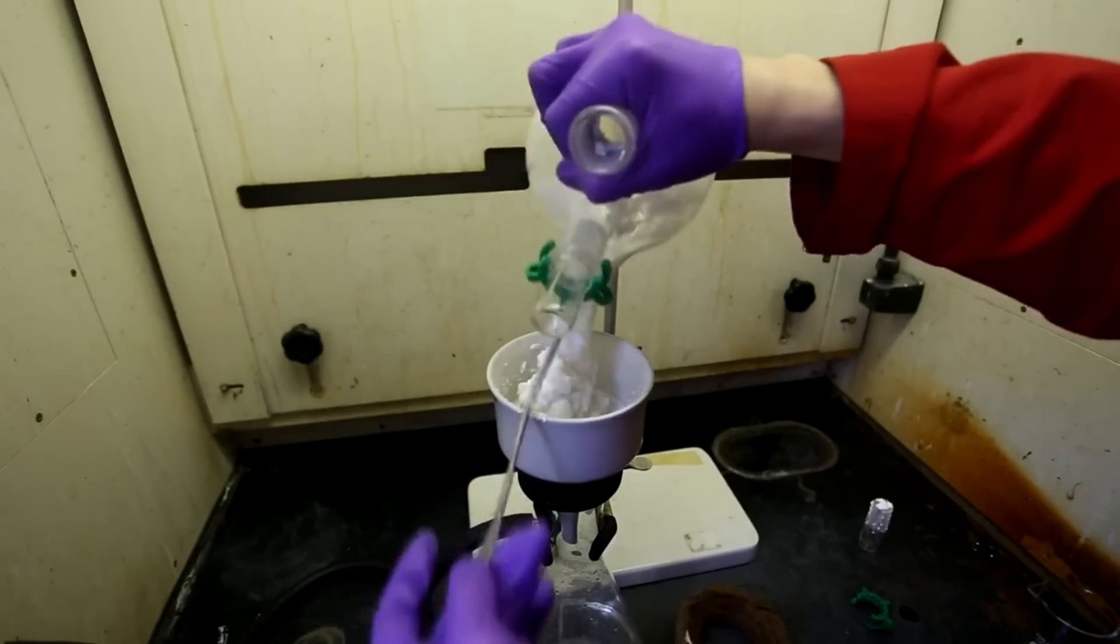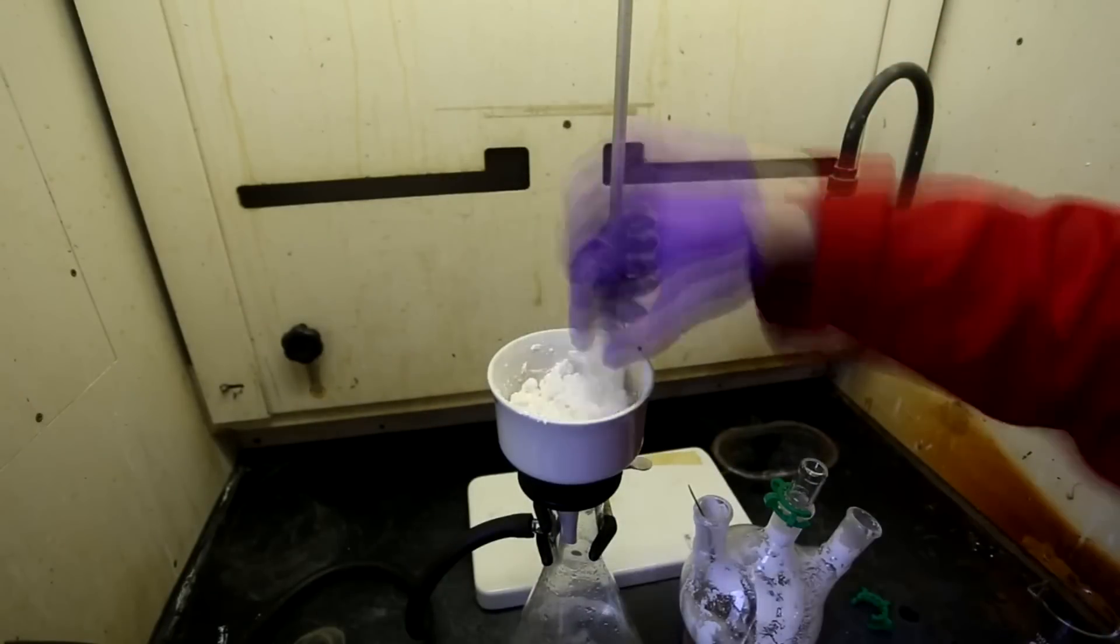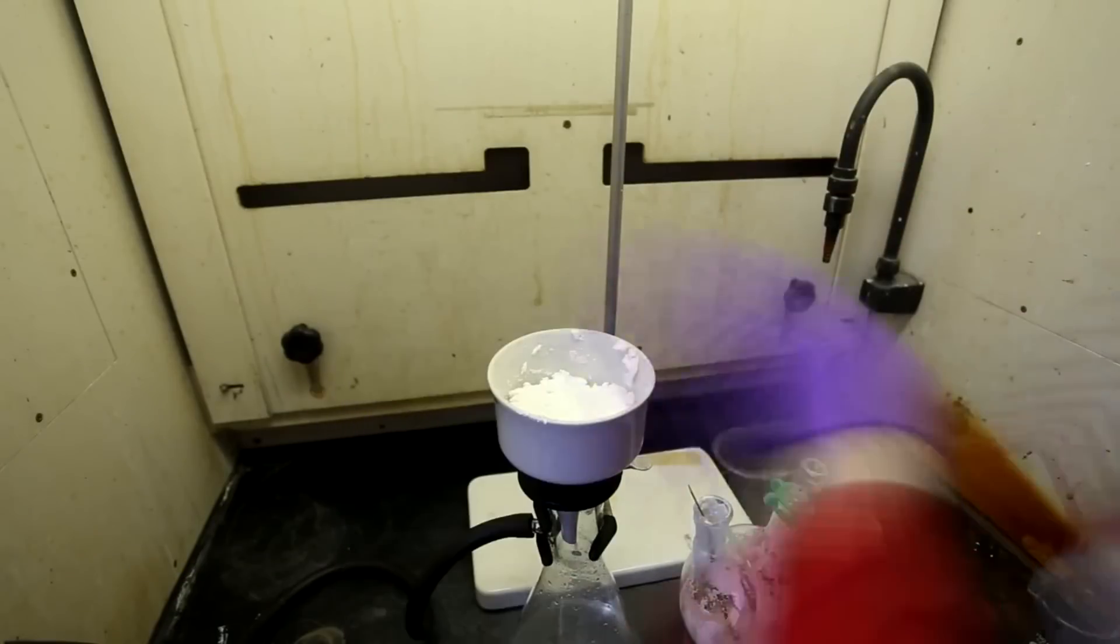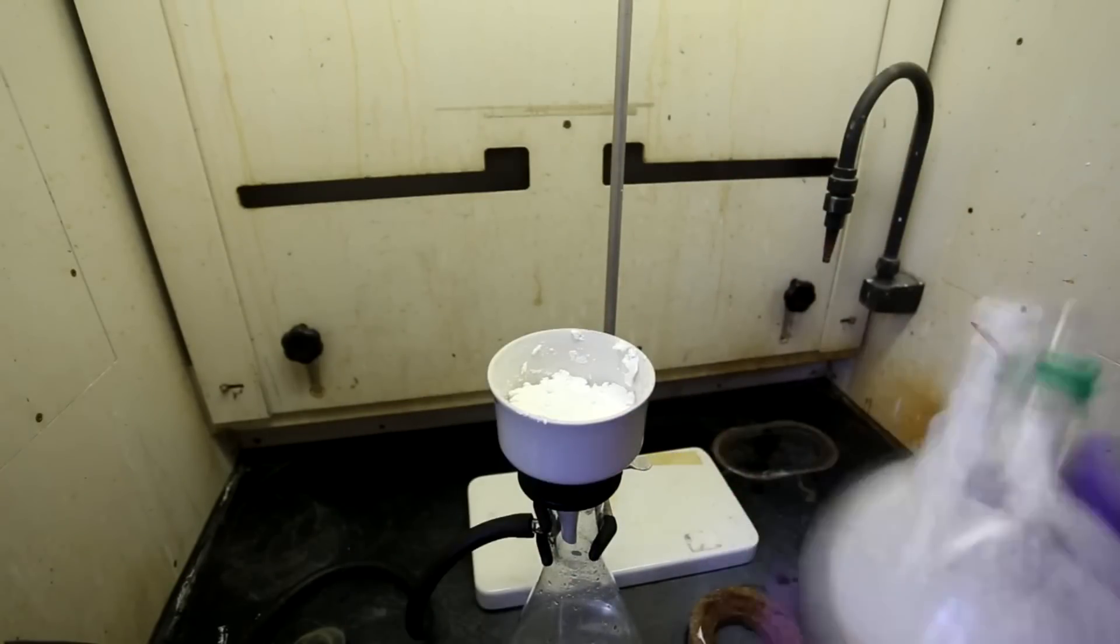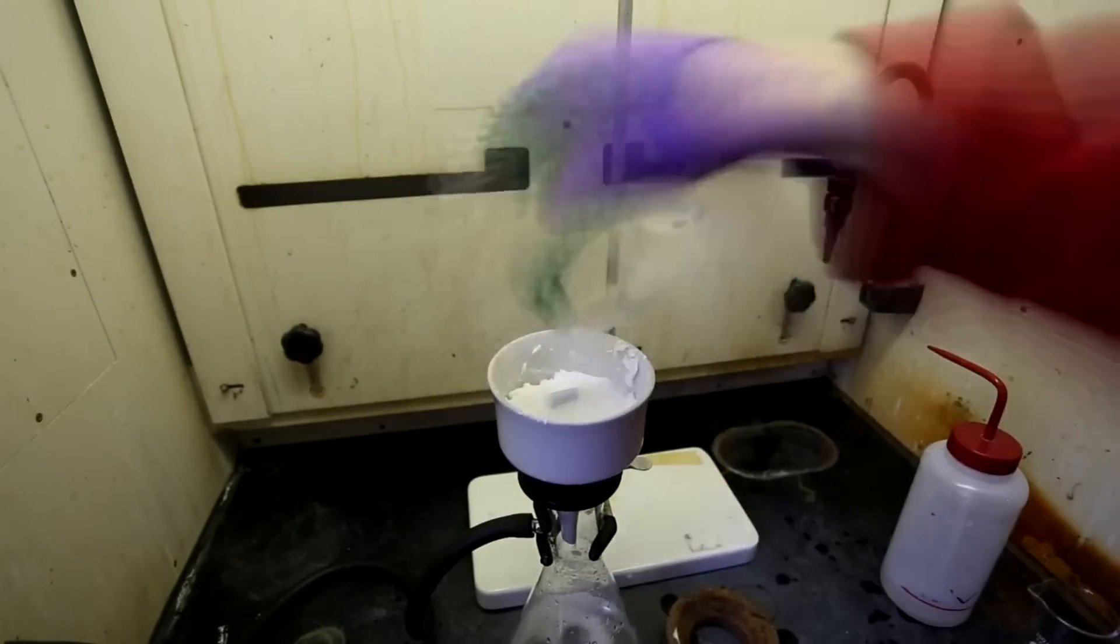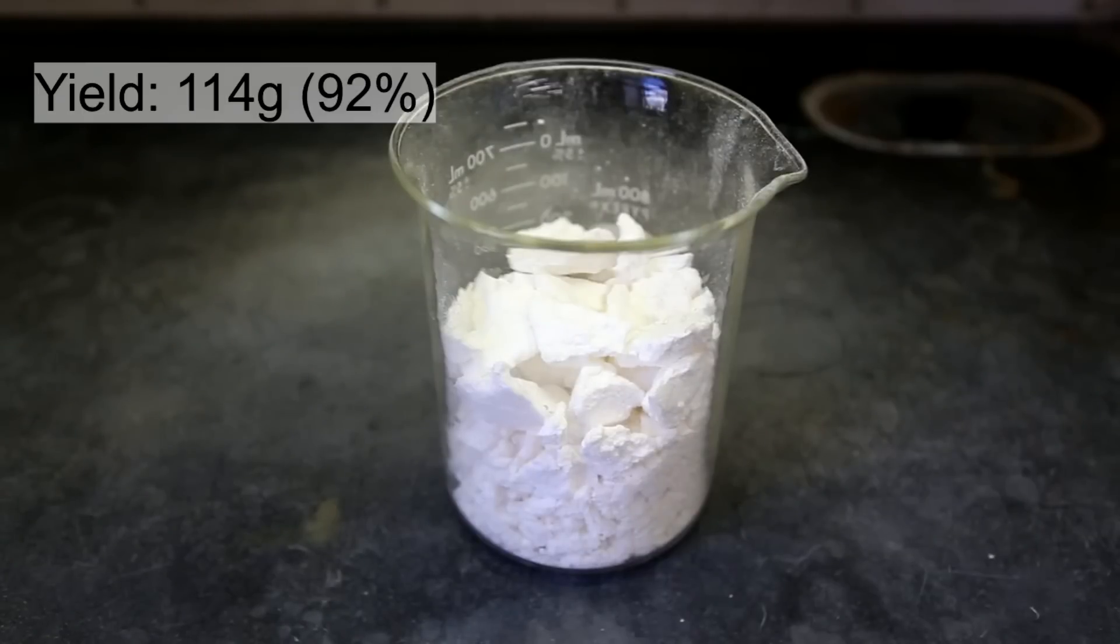I did not use enough water to wash so in the end there was still a slight hard to detect scent of hydrochloric acid or acetic acid in the product. The three necked round bottom flask was washed with as little cold water as possible, and then each time the washings were transferred to the Buchner funnel.